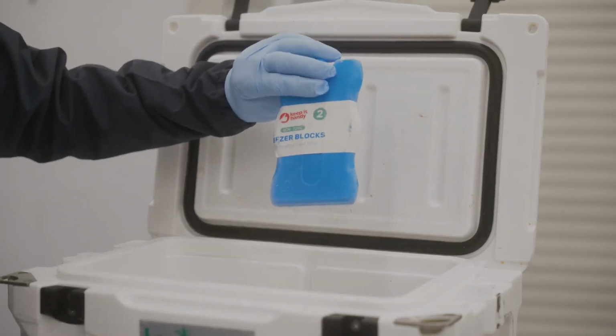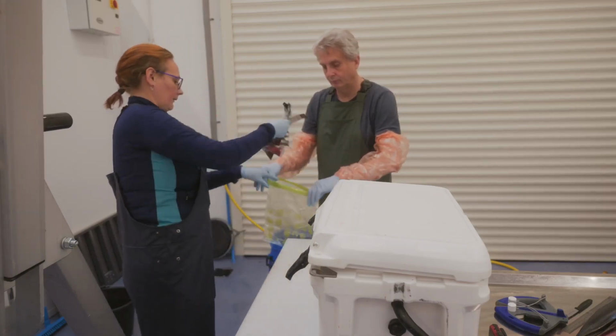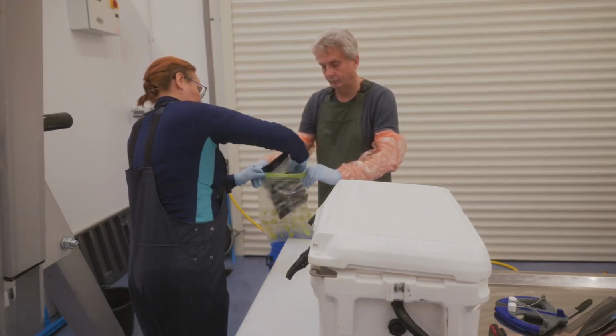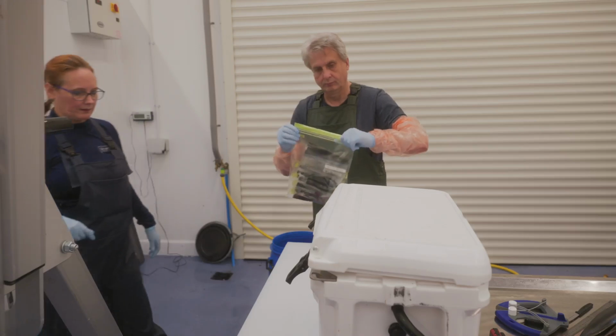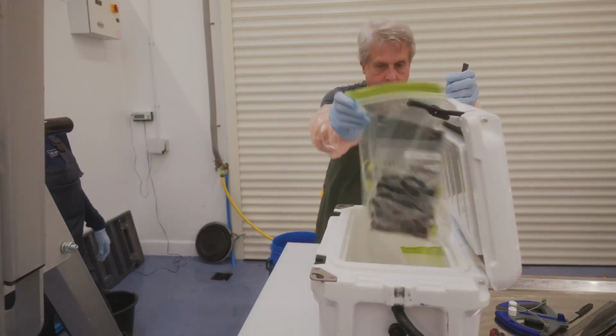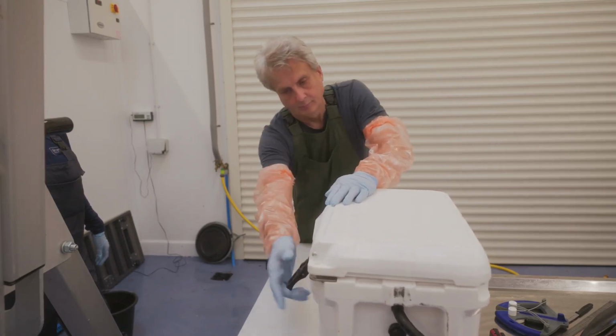Maintain the cold chain for all bacteriological samples. Store them between 0 and 4 degrees and transfer to -80 degrees as soon as possible. If immediate culture is planned, do not freeze. However, if culture is to be delayed, freeze as cold as possible.